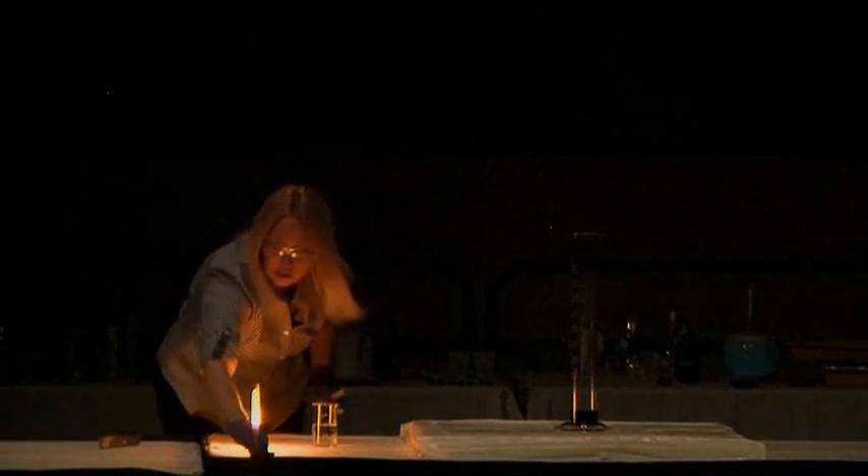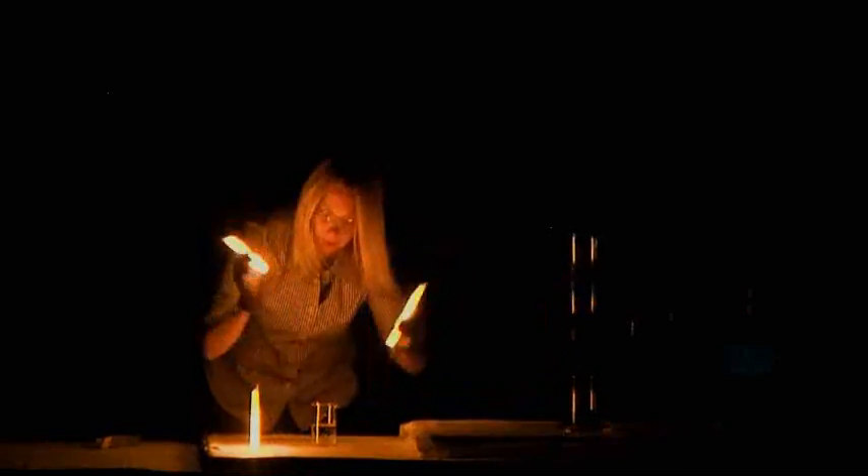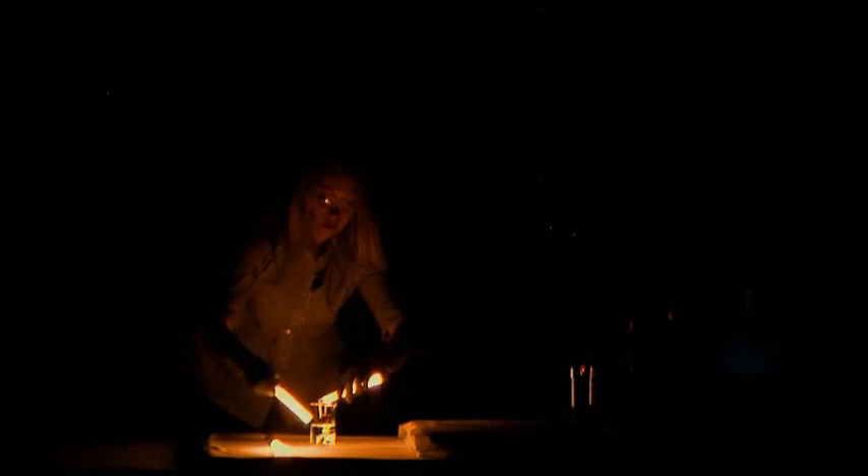You've got five minutes on these light sticks — that's all you've got. We don't have five minutes. There's something really glowing cool up here on the table under this. I get kind of excited. Cut the light stick open. Pour it down into the peroxide.